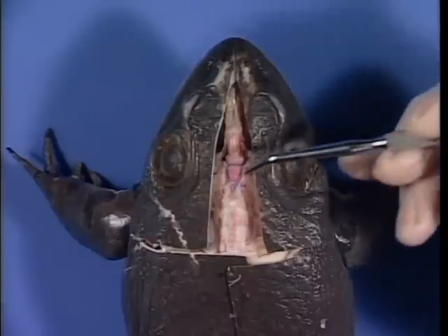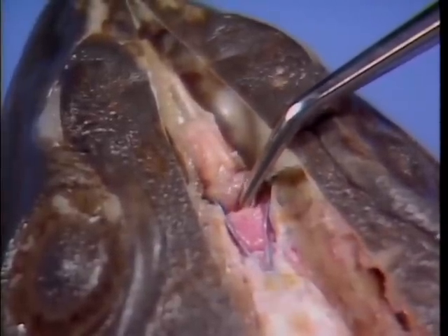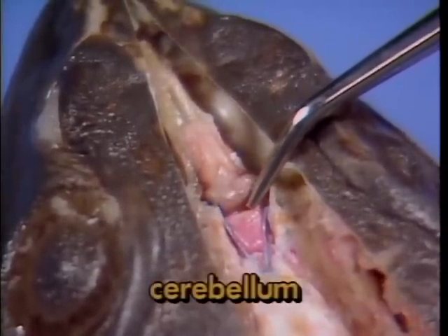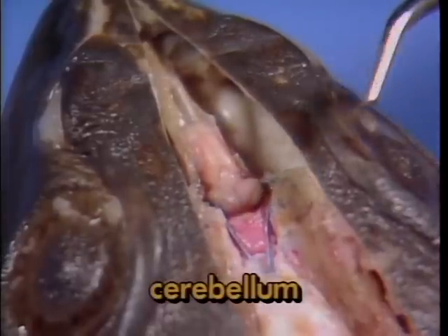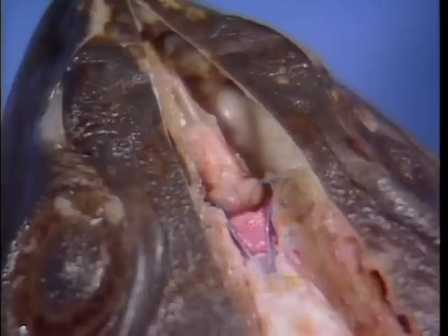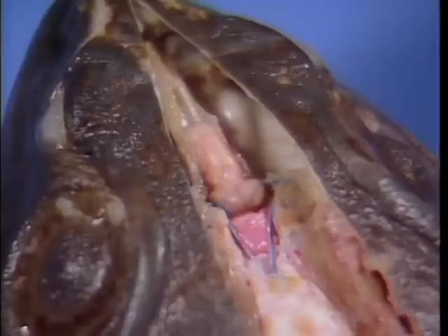The single tubular portion of the brain just posterior to the optic lobes is known as the cerebellum. It is to this portion of the brain that sensory information from the ear, involved in hearing as well as equilibrium, is sent. A major responsibility of the cerebellum is the coordination of skeletal muscle activity involved in locomotion, feeding, and mating behavior.